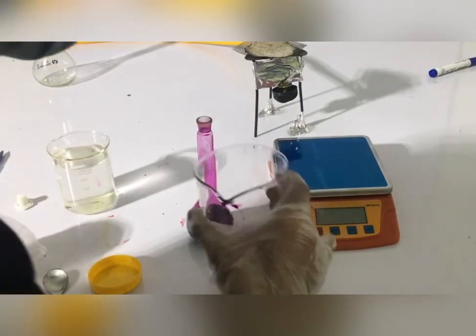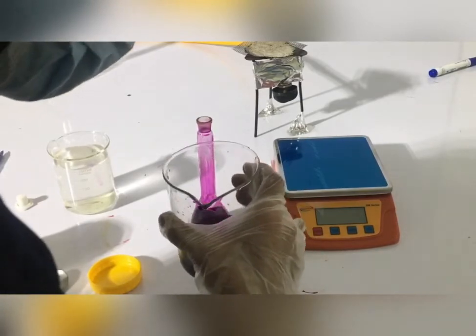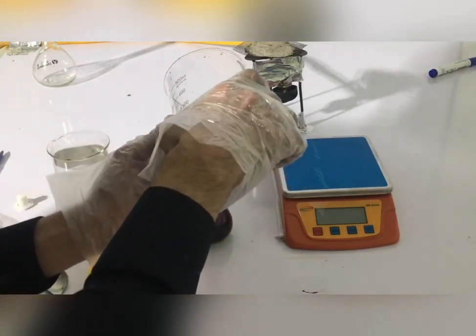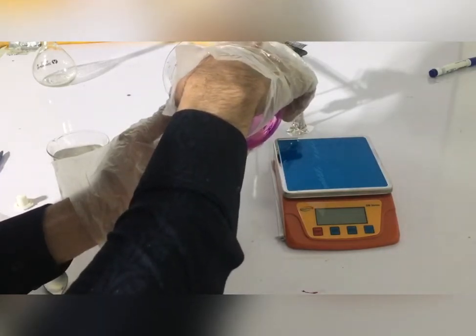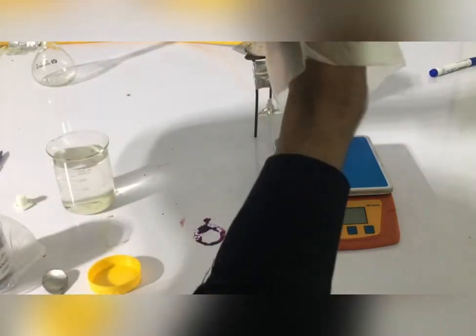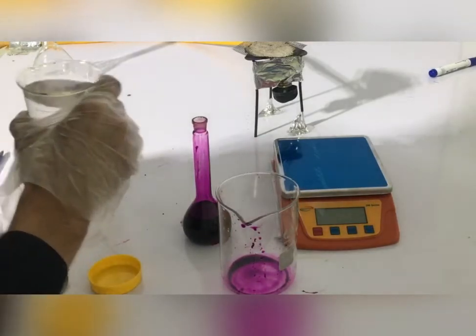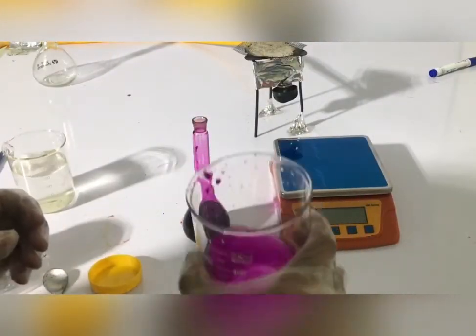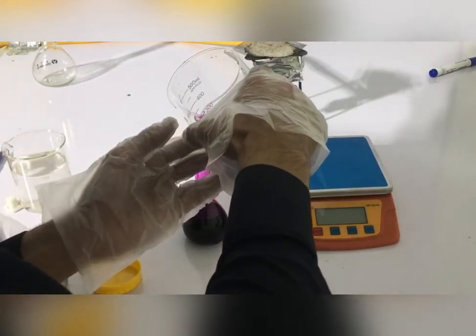Inshallah, the exact solution is ready. I will do the same thing. I'm going to put it in the water. The water gets filled. After the water is ready, it will be filled with 100 ml and the water will be filled to the mark.